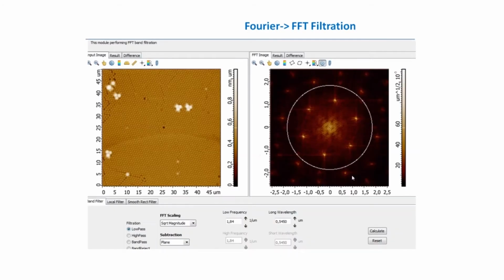And what does it mean? What does the Fourier transform mean? Fourier transform transforms our image from normal space to the frequency domain. And this is an example: from the left side we see the normal image, from the right side we see the image in the frequency domain.